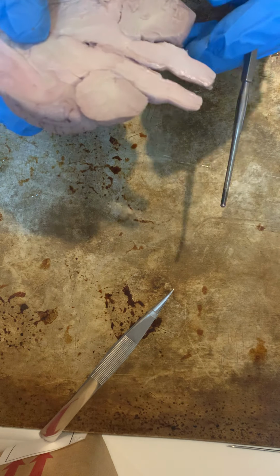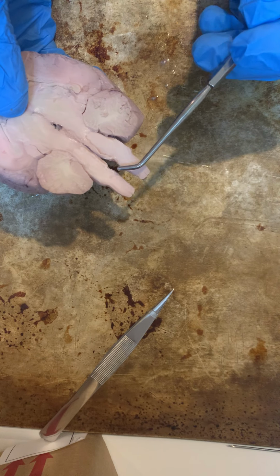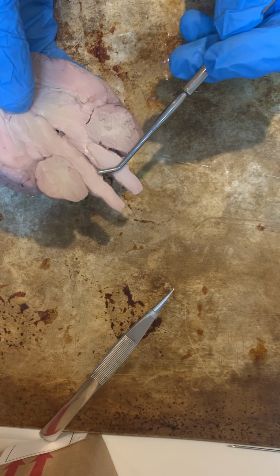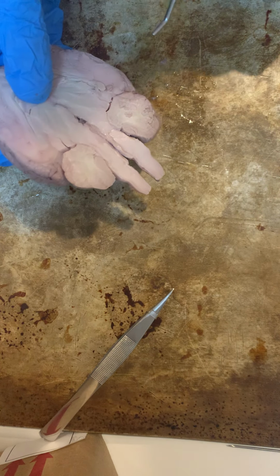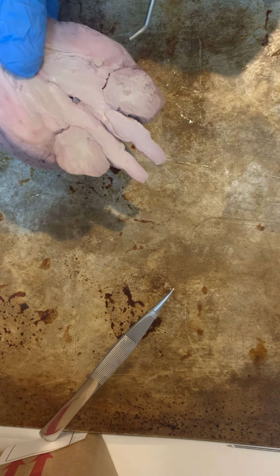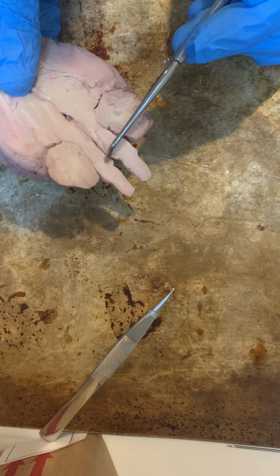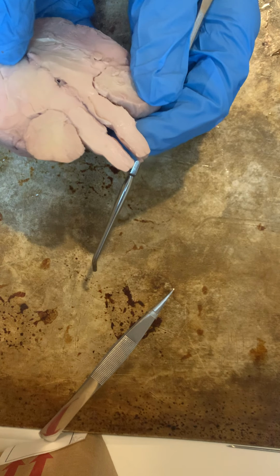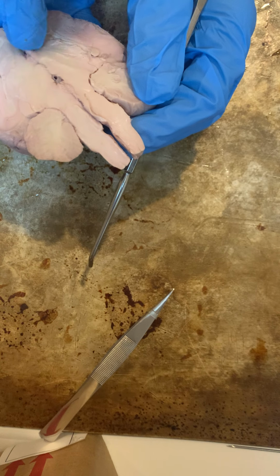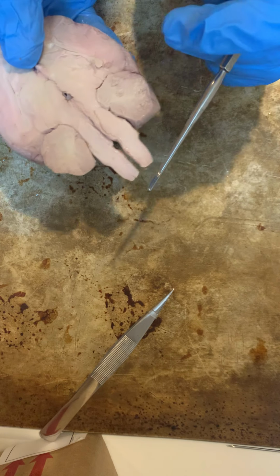And the brain stem has the medulla right here, and I apologize, the brainstem takes part in regulation of the heart rate, breathing, sleeping, and eating. And then the medulla, which is about right there, it's a bit difficult to see on mine. The medulla is the control center for the function of the heart and the lungs. This here, which is the medulla, is part of the brainstem. It regulates breathing, sneezing, and swallowing.